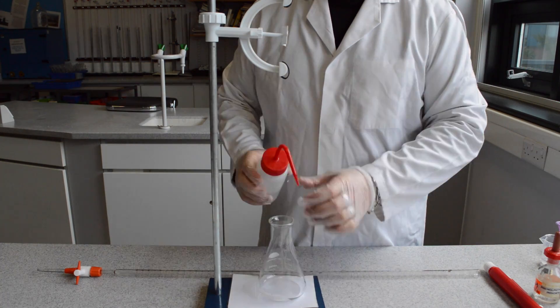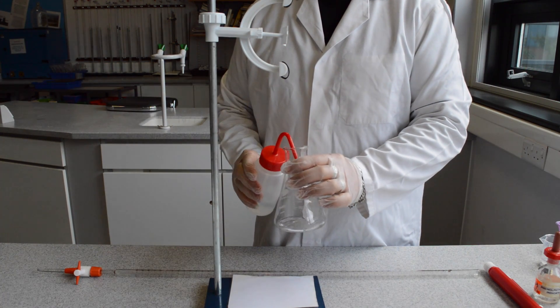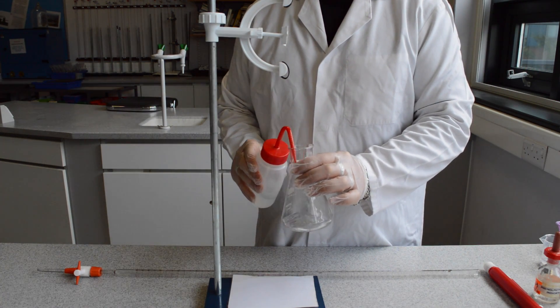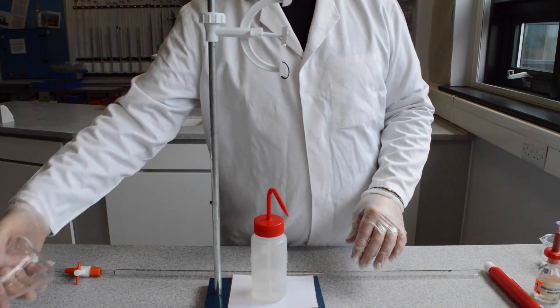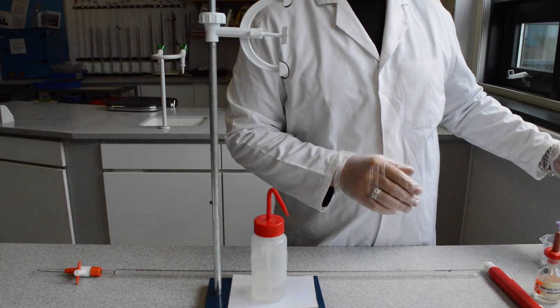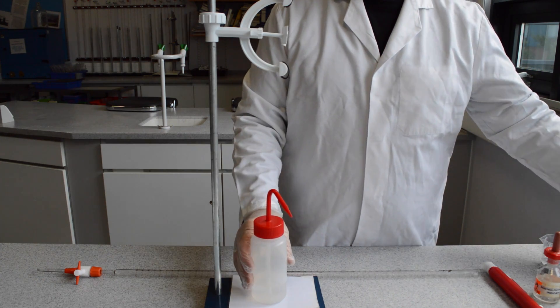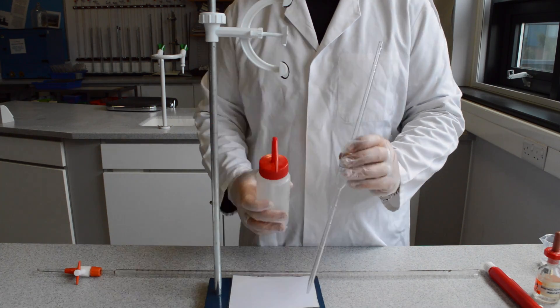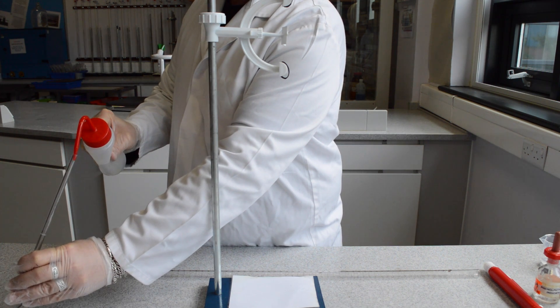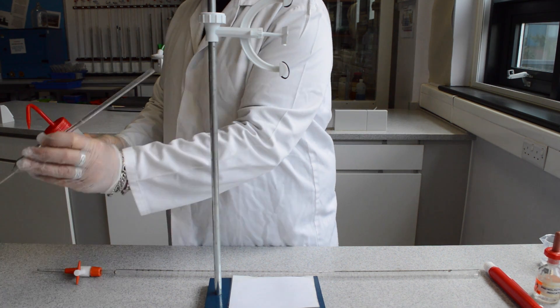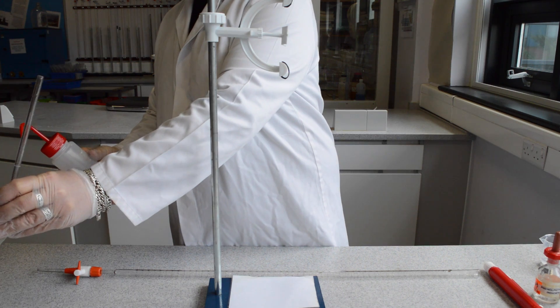After performing a titration or any lab task, your equipment should be thoroughly cleaned before putting away. This is good lab practice and will count towards your assessment. The examples on screen can be followed easily to ensure that your titration equipment is clean before returning to the trolley or the lab bench.